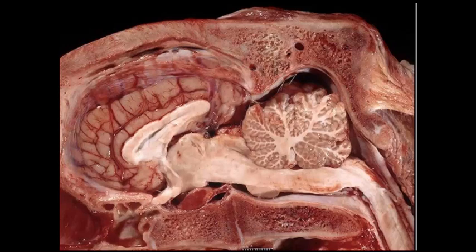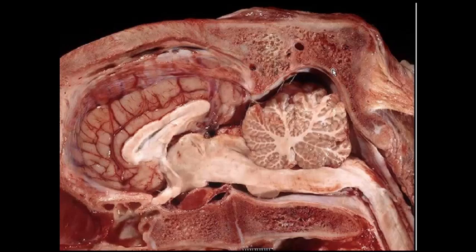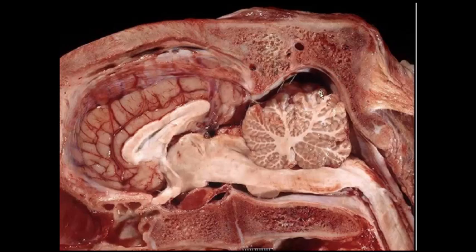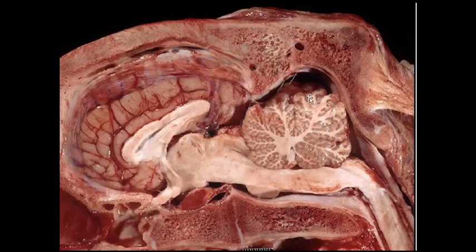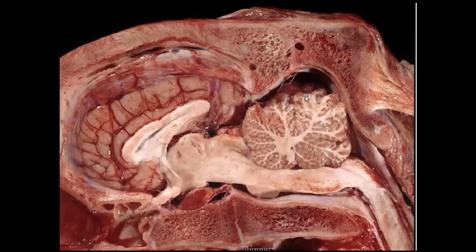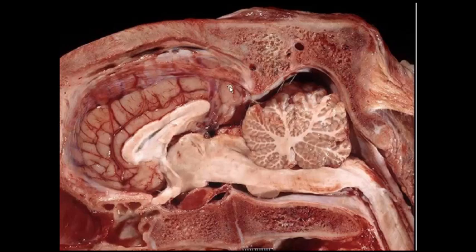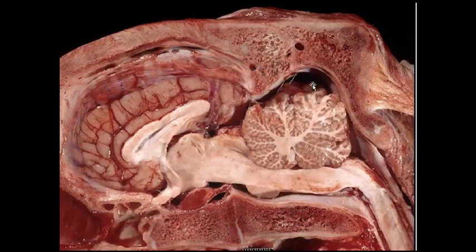We're here in the brain of the horse — cerebrum, brainstem, and cerebellum. I see a little extra space within the cranium in the area of the cerebellum, and the folia look very moth-eaten. The gray matter is gone in some areas, so the white matter looks a lot bigger than it should. This extra space clues me in — I'm going to look at the rest of the brain and look for a cholesteatoma or something like that, but there's just too much space here.